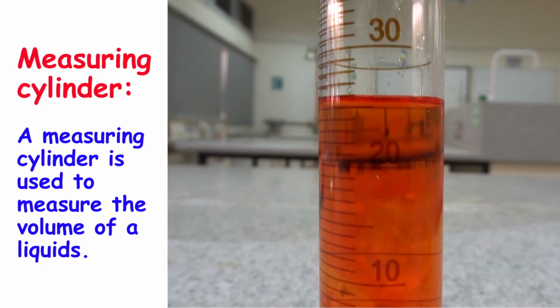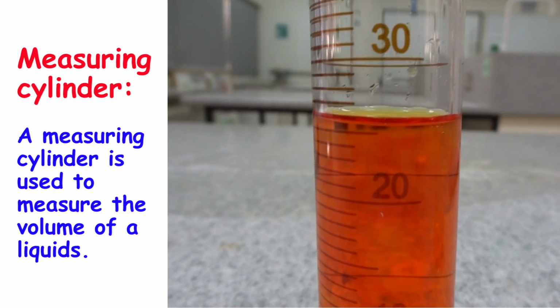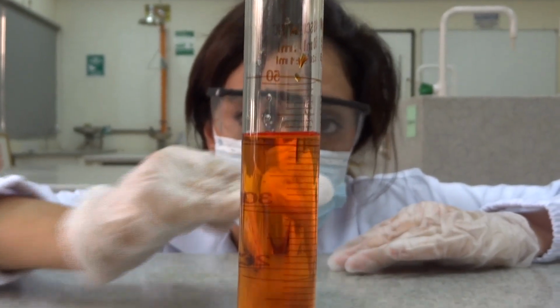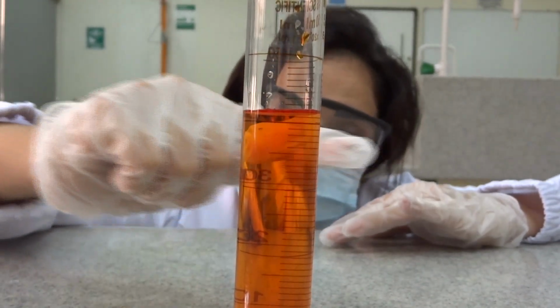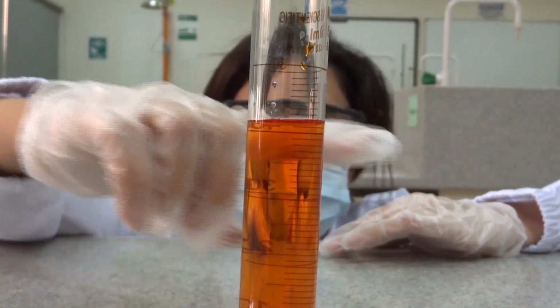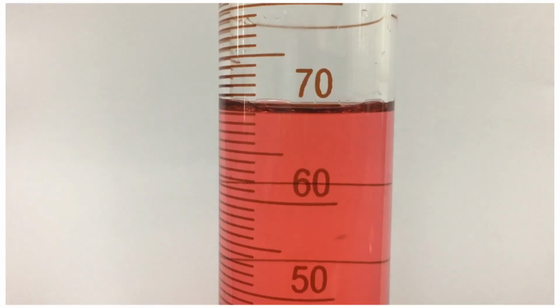Cylinder. A measuring cylinder is used to measure volumes of liquids. The volume is read from the bottom of the meniscus. Accordingly, the eye level must be at the level of the bottom of the meniscus to have an accurate reading.